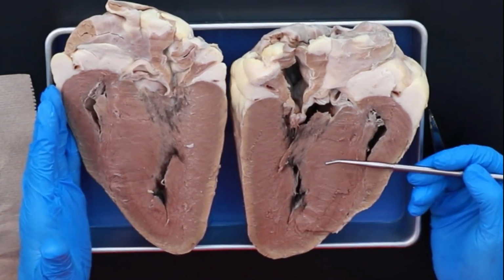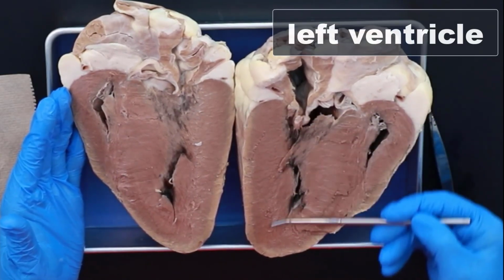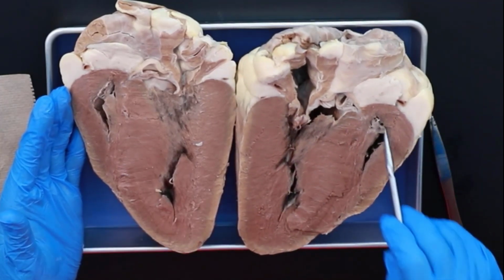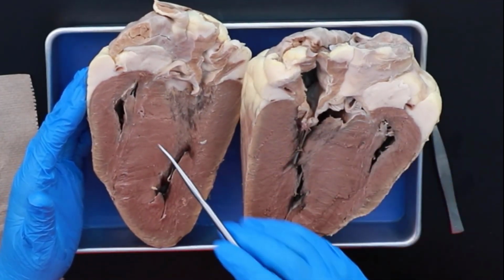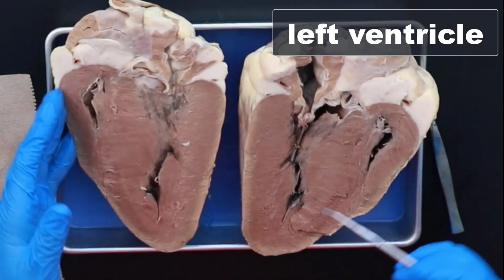This is the pumping action of the heart, okay? So this is the left ventricle, this is the right ventricle, here's your whole right ventricle, left ventricle. I've cut this a little off center so you can see more of this valve better. But there's your right ventricle, left ventricle.